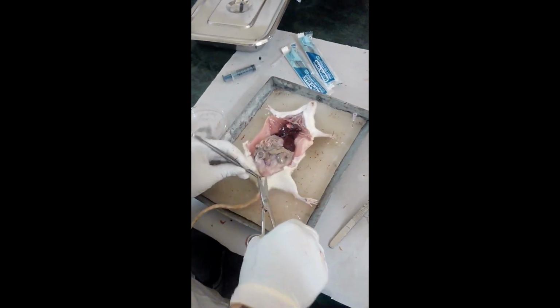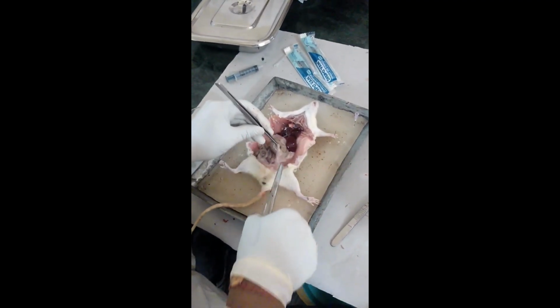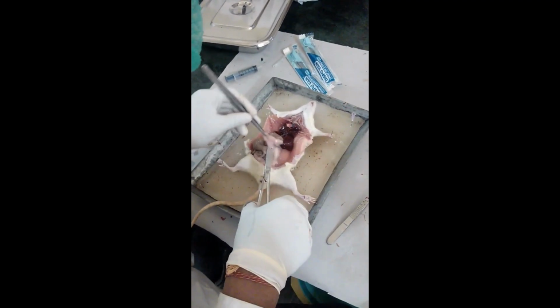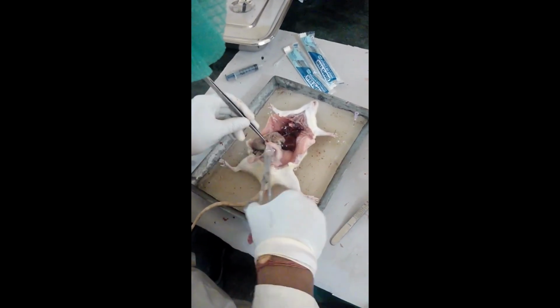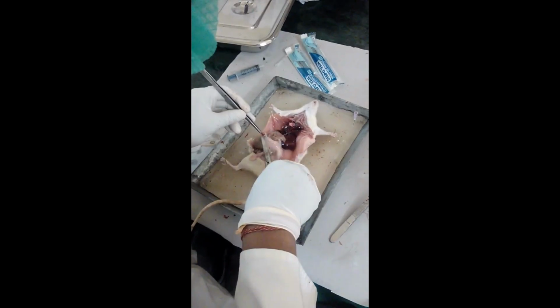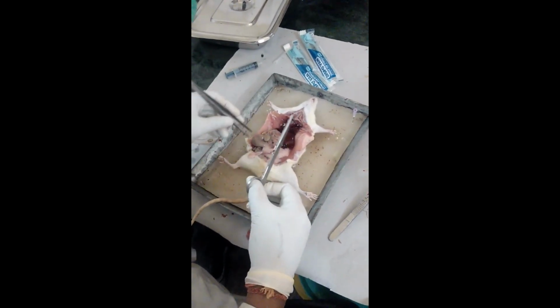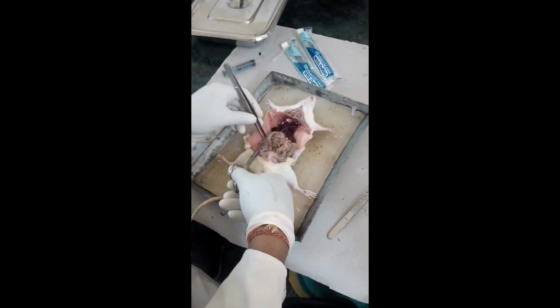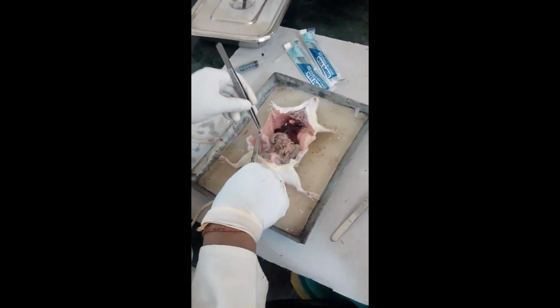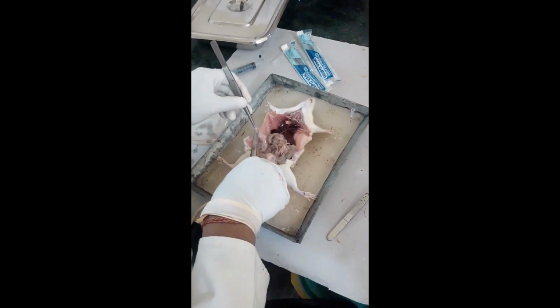Adrenal gland. First, locate the adrenal glands on both sides. They are small structures situated above the kidney. It is difficult to find them later, so first we have to find the adrenal glands and remove them. You have to find both sides. It is very necessary to remove them first, otherwise you will not be able to find them later.